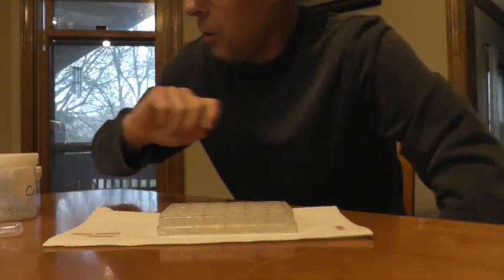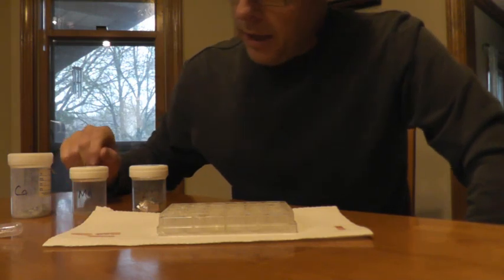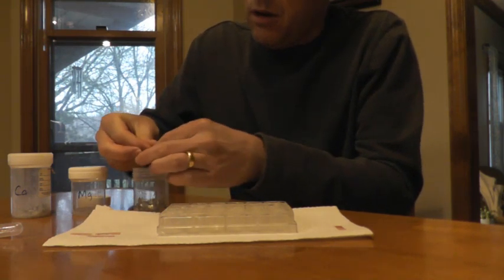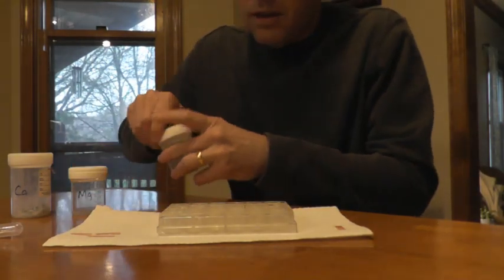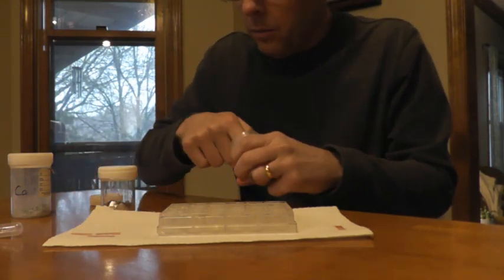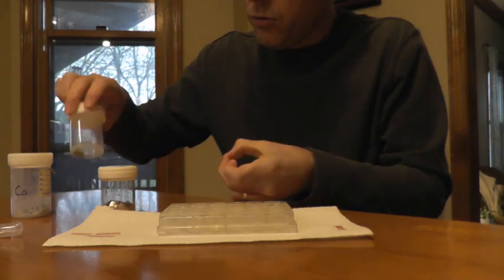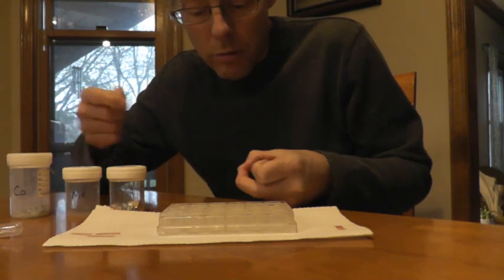Okay, so I've got several metals here: aluminum, magnesium, and calcium. And we're simply going to stick a piece of metal in each well, and this is simply aluminum foil. So I'm going to stick it in the well, and got a piece of magnesium. And if you look at it, magnesium and aluminum are on the same period. They're on the 3rd row of the periodic table. So we're going to look at a row trend, and then magnesium and calcium are both in the 2nd group. So we're going to look at a group trend as well.